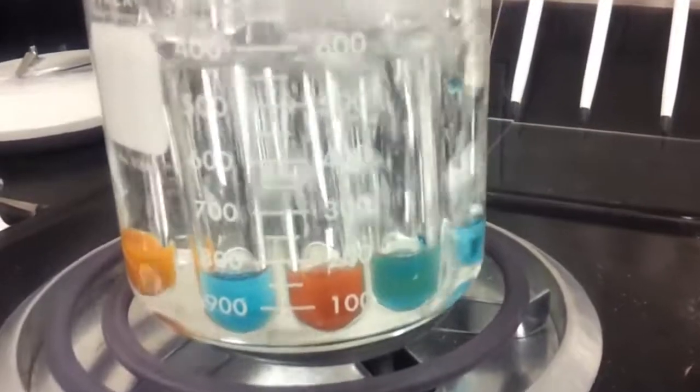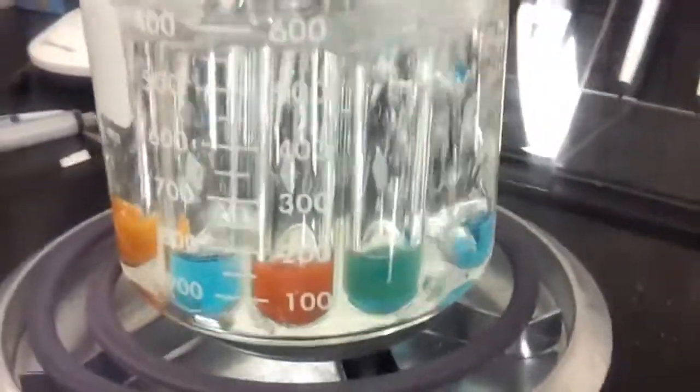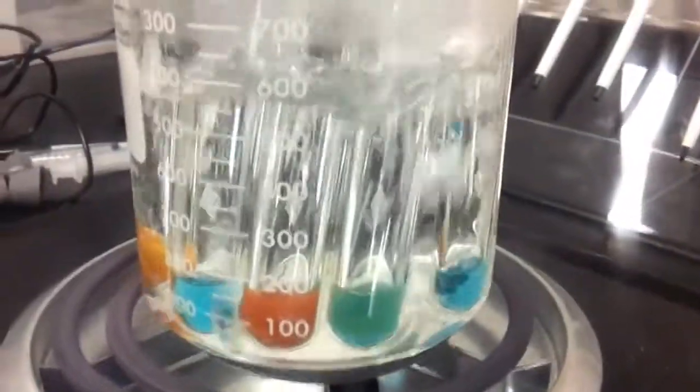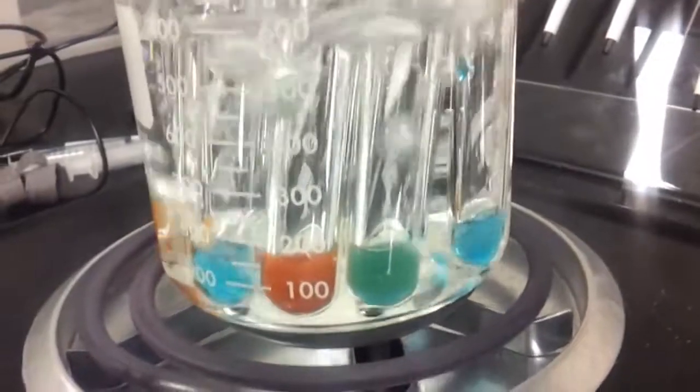Now, if you look to the solution that's to the right of the brick red one, you can see that it's also starting to change colors. That's the potato solution, is turning a green color.